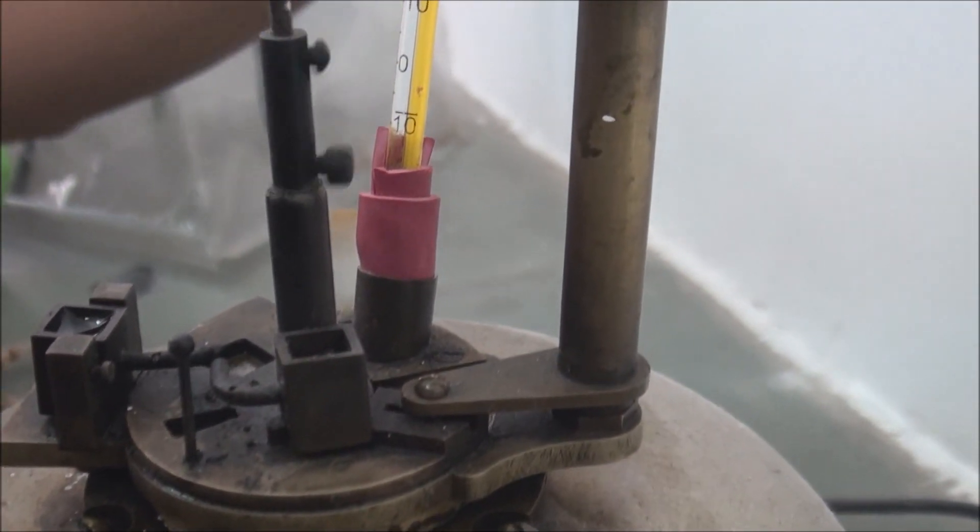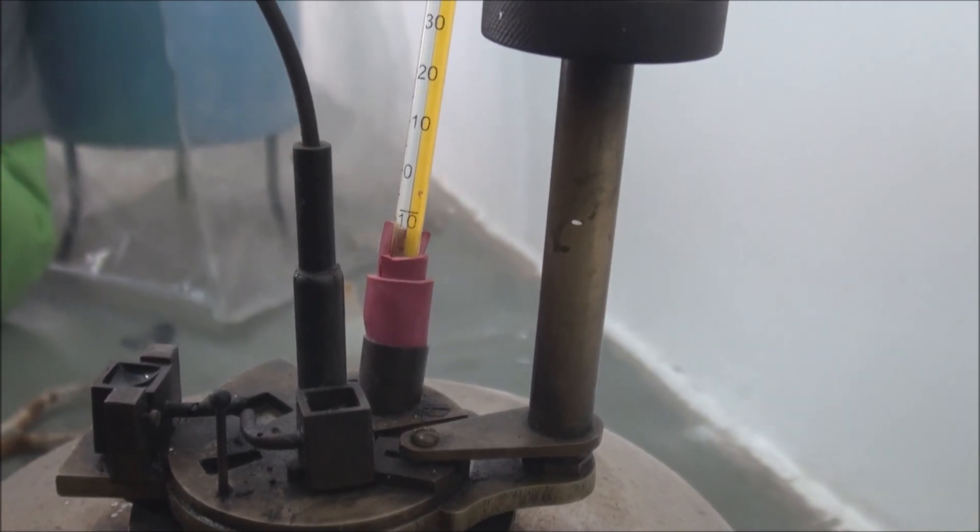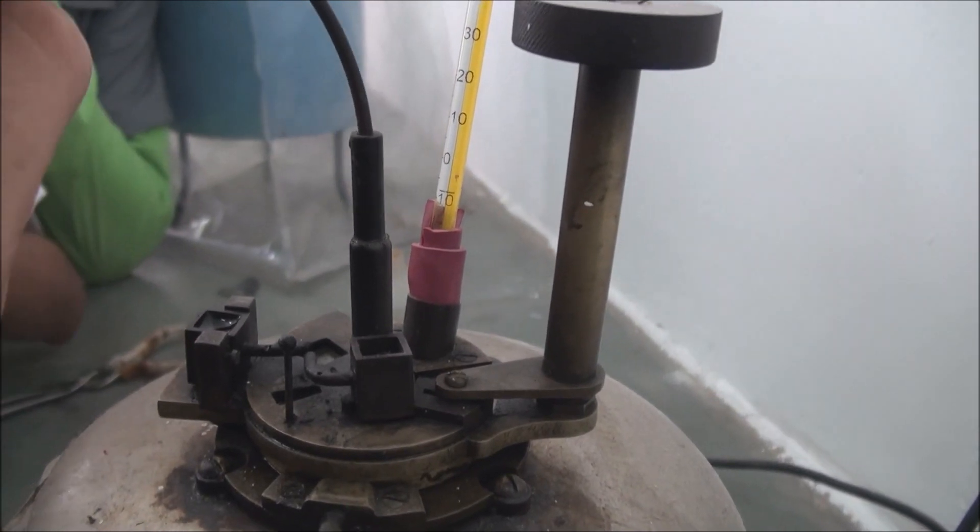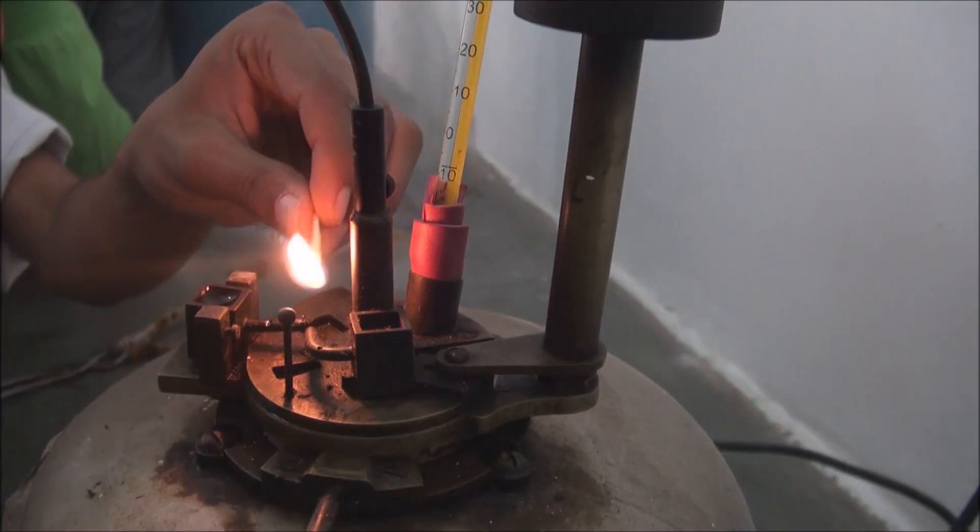Also, if the temperature increases beyond a certain range, you can see the fire point. The fire point is the temperature at which the flame stands for exactly 5 or more seconds.